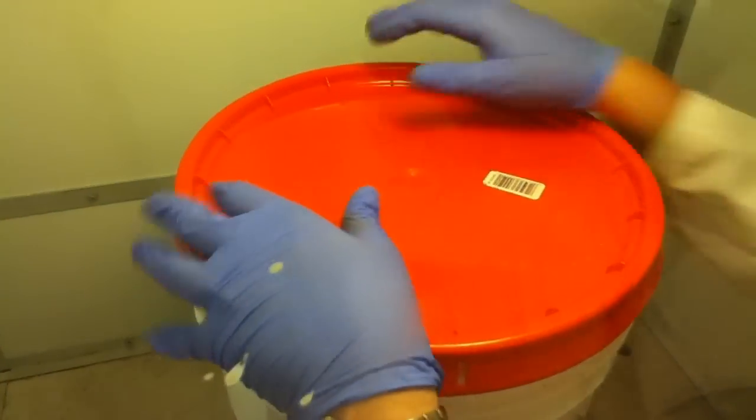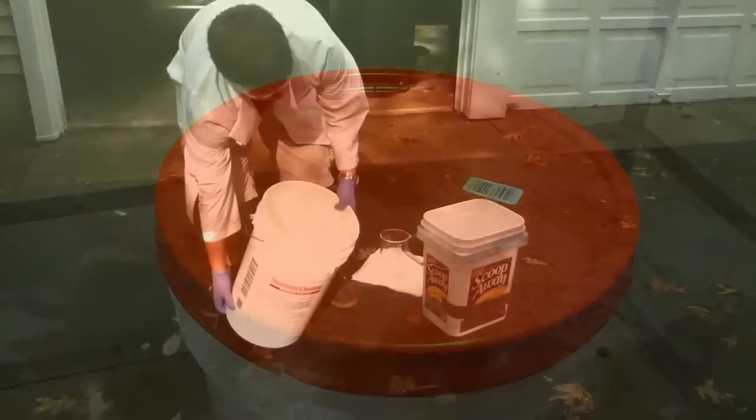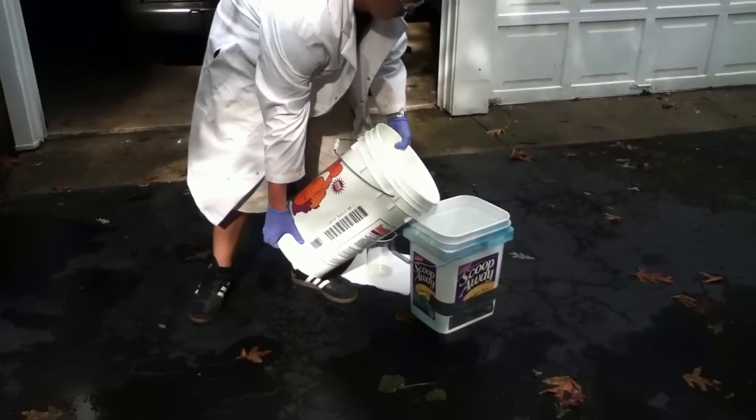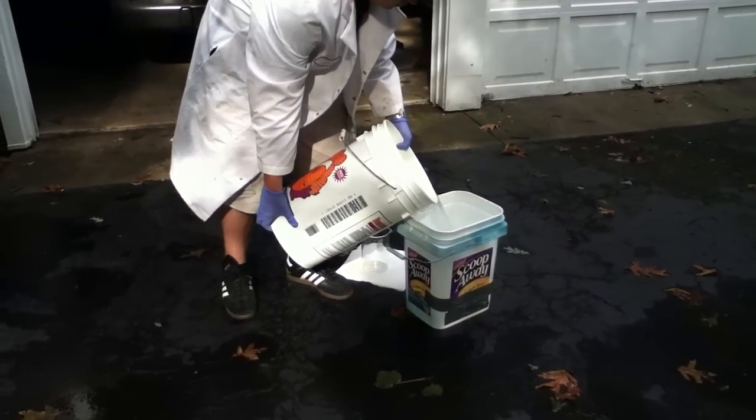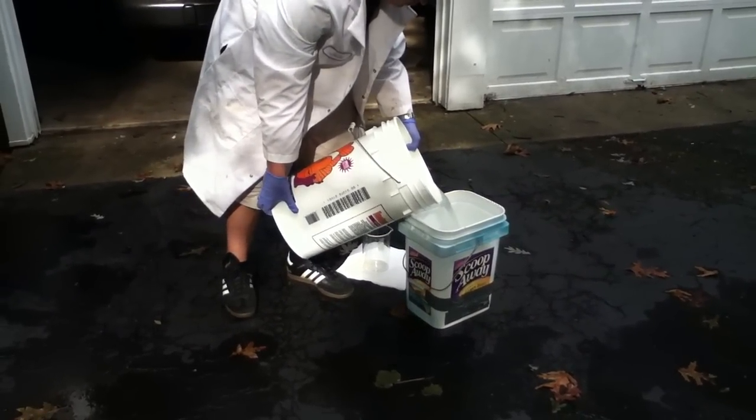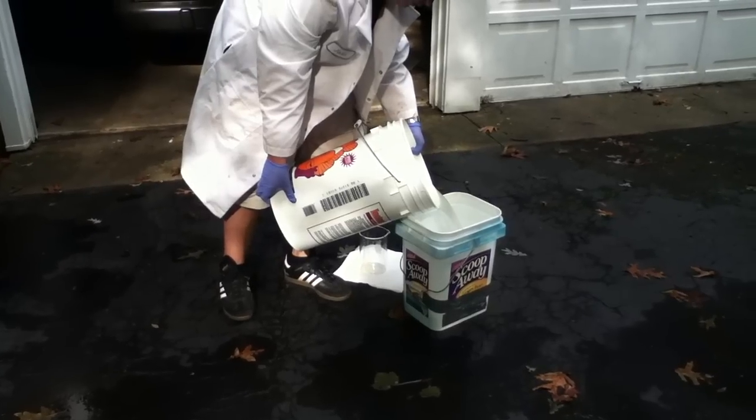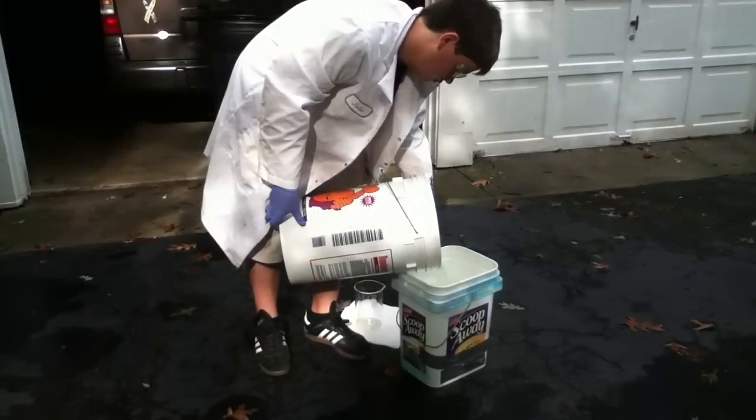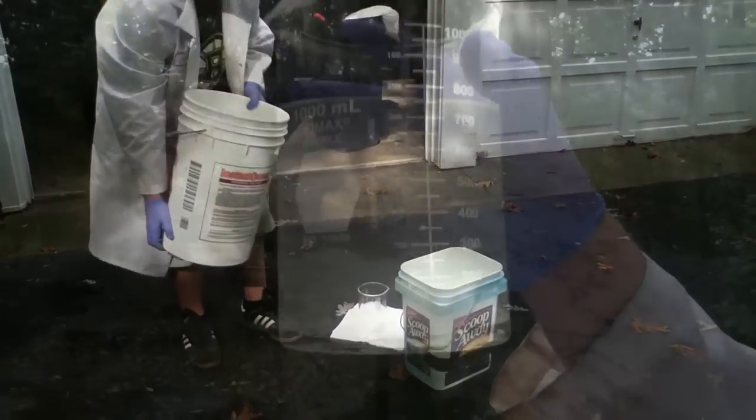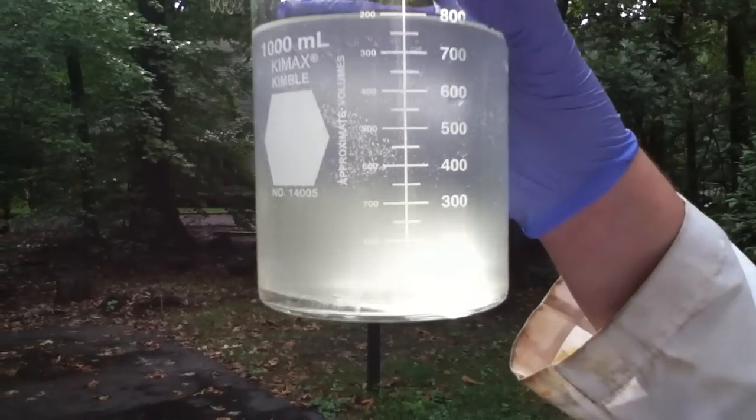Cap the bucket and leave it to sit for 30 to 45 minutes. Decant about 4 gallons of water into another container. Here you can clearly see the lower layer of chloroform.